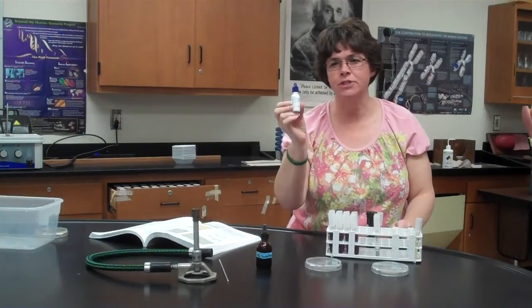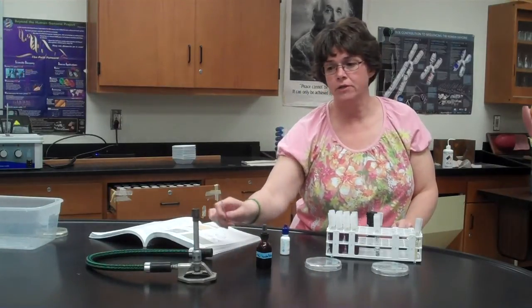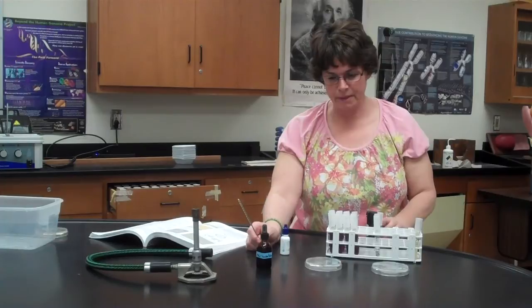When you do the wet mount for it, we're gonna be taking from a solid medium. So instead of doing water, you're gonna do a drop. It says a couple of drops. I think 1 drop is always sufficient. So a drop of this, and then you're gonna use your sterile technique. You're using your inoculating loop and your Bunsen burner, and you're gonna take a loop full of the specimen.